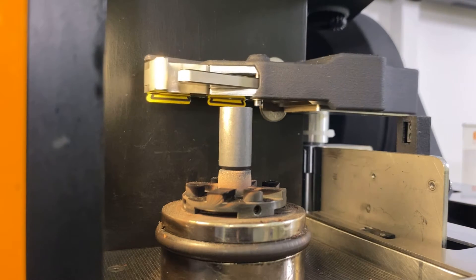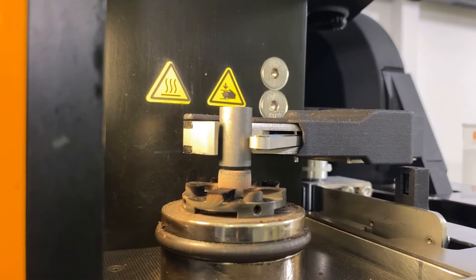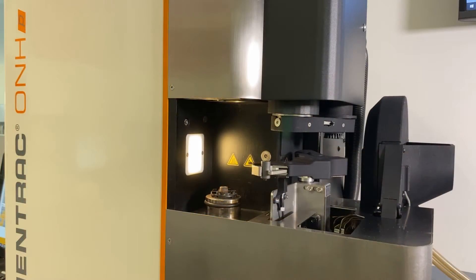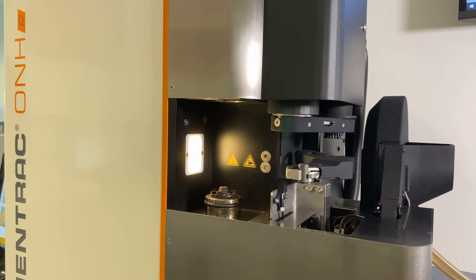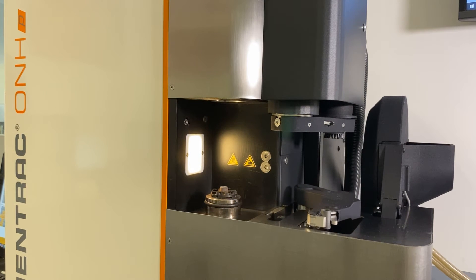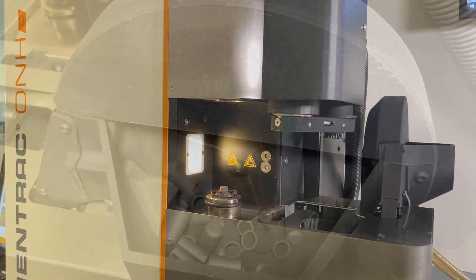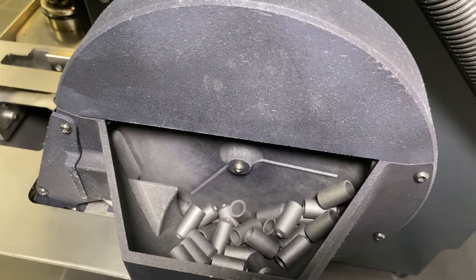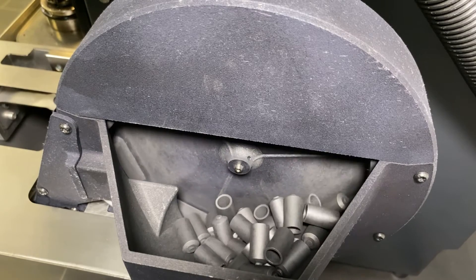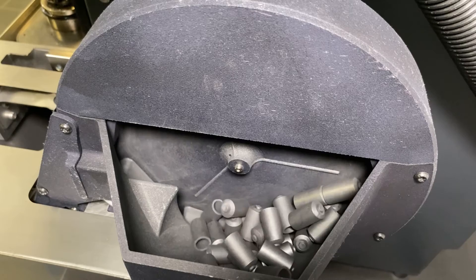The gripper arm removes the crucible after analysis and disposes of it in an integrated waste container. In parallel, the next crucible is automatically aligned for analysis. Necessary accelerators are intelligently fed via the sample carousel.